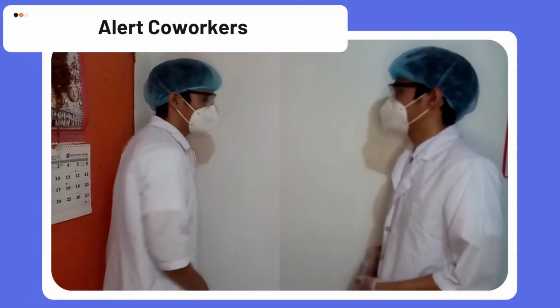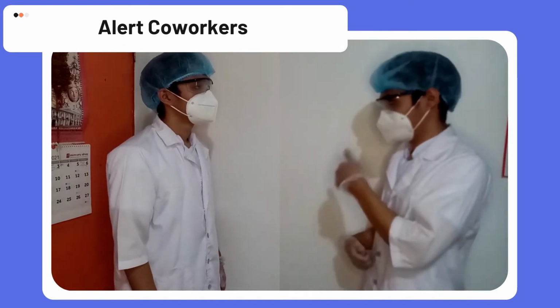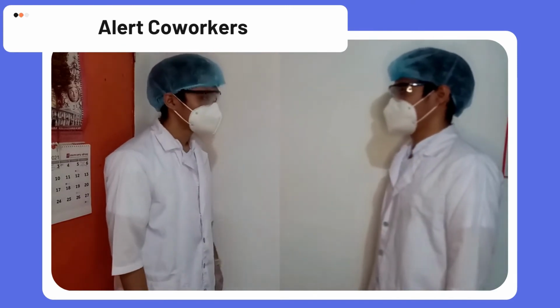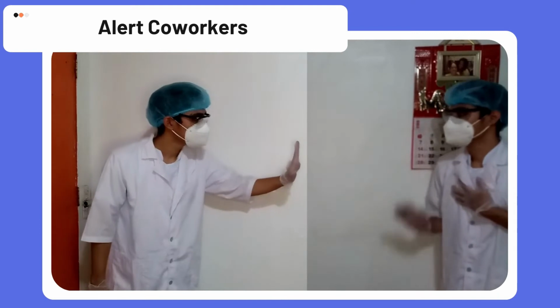Step 2 is to alert your coworkers. Let people around you know what spilled and that you are going to clean it up. Incidental spills don't require evacuation, but you want to ensure that no one else walks through or becomes contaminated.